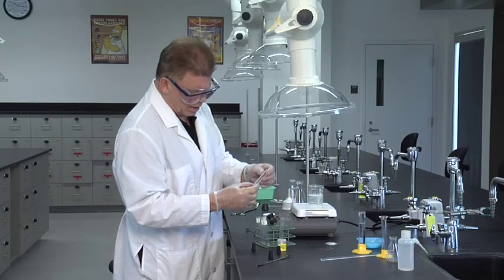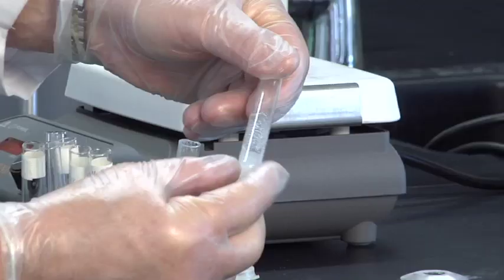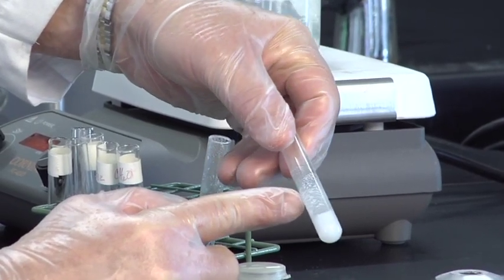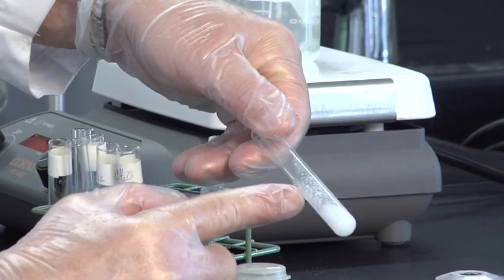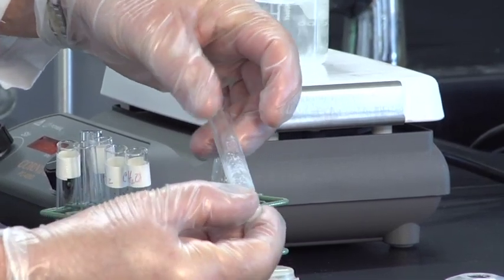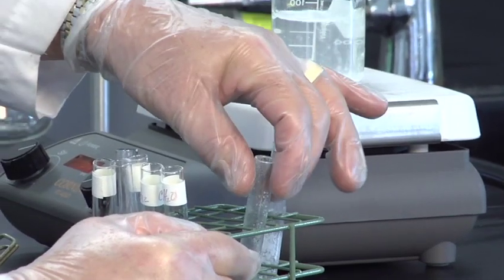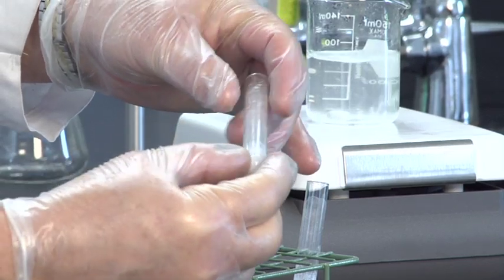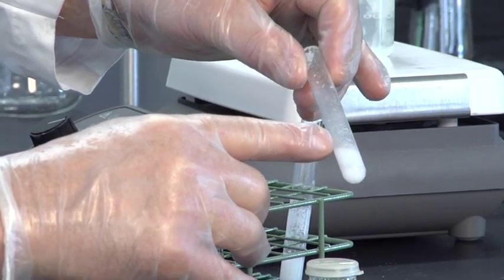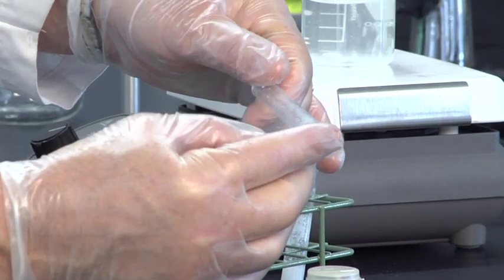I'm flicking the tube so we can get some crystals up onto the wall. These are some small but nice little crystals forming in the cyclohexane — so the cyclohexane is working. Look how much is coming out. And here is the one in water — this tube is still warm, but there are very nice needle-like crystals forming on the wall of the tube. So this is working really well.